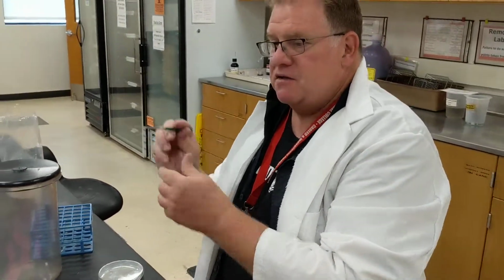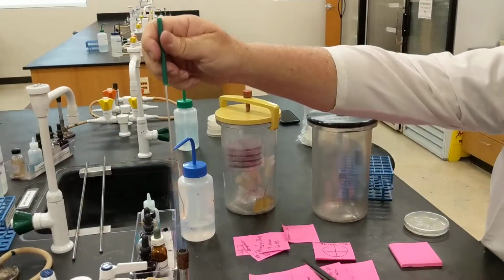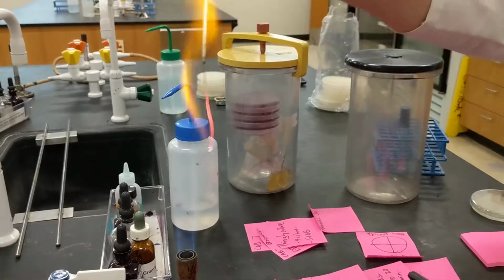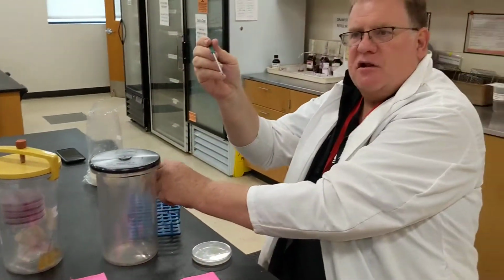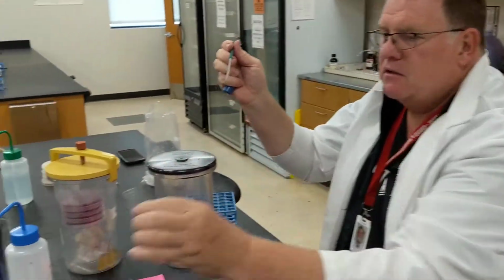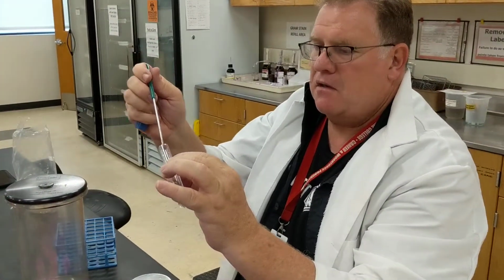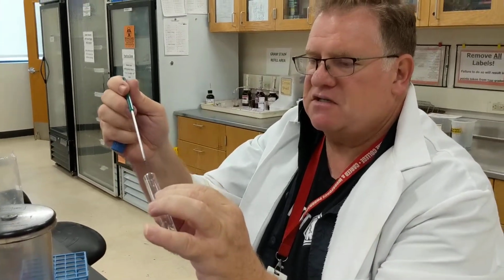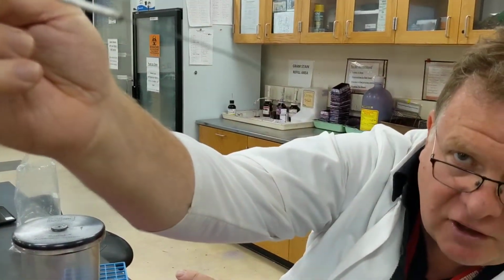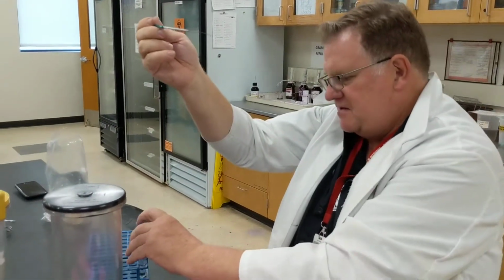And then what you want to do is, again, go ahead and flame your loop. Get it all red hot all at once. You just go slowly. You don't need to wave it, things like that. And you get your culture. Try not to touch the sides of your culture. Again, as always, when I'm going through liquid culture, I want to make sure that I have a little drop on there, although that's not necessary.